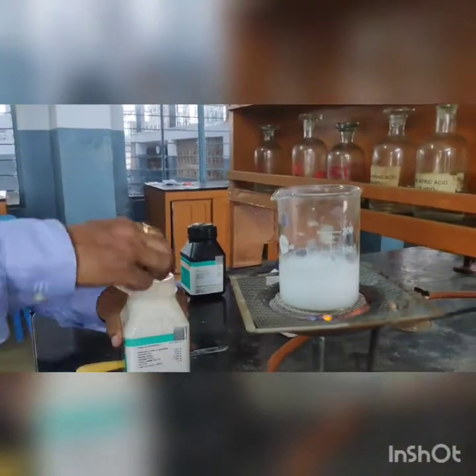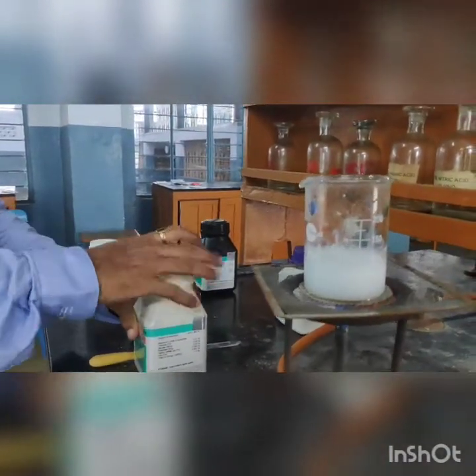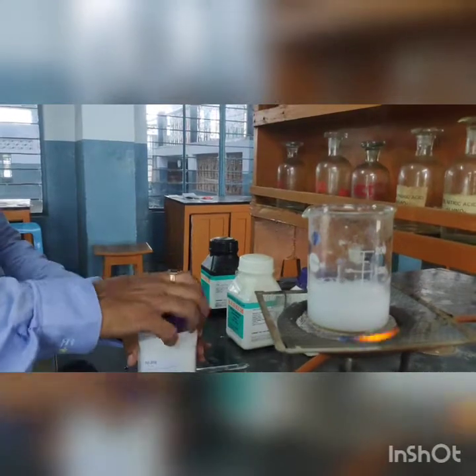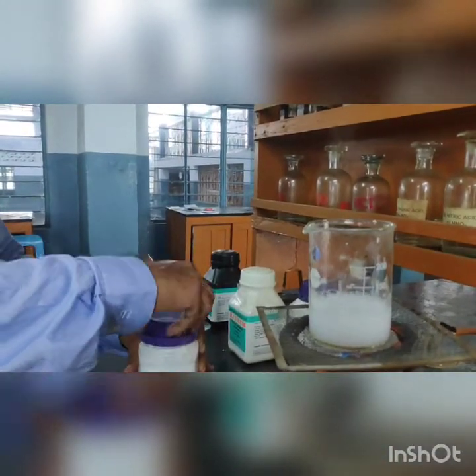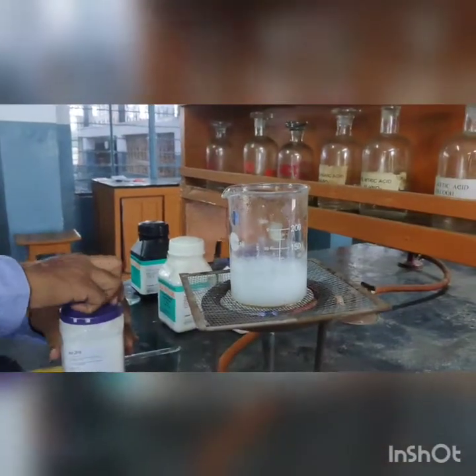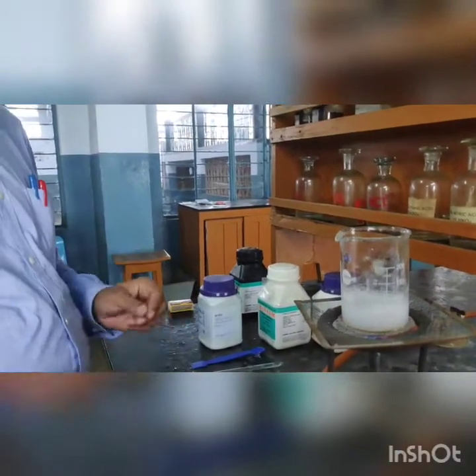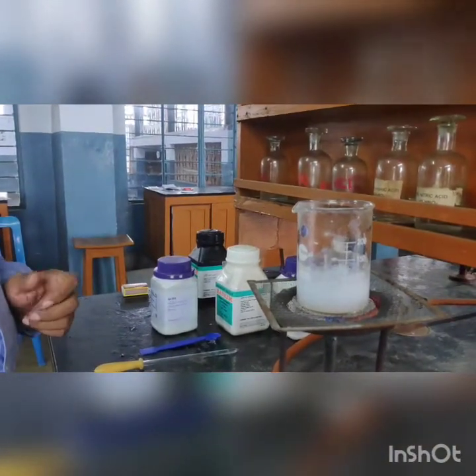According to the theory, in this reaction the cations will get converted into the carbonates, and the anions will be obtained as soluble sodium salts in the filtrate. We will wait while this is being boiled — it has to be boiled for about 5 to 10 minutes.